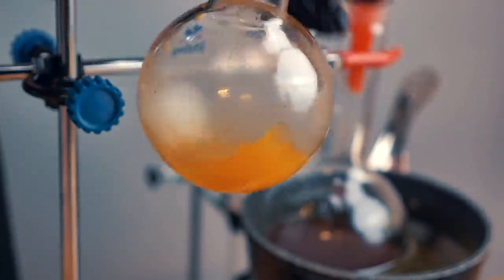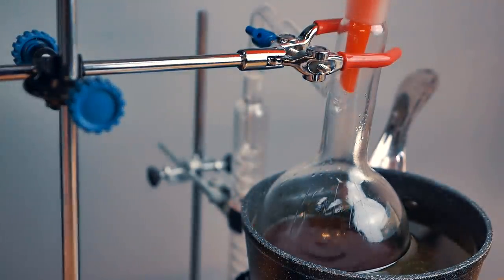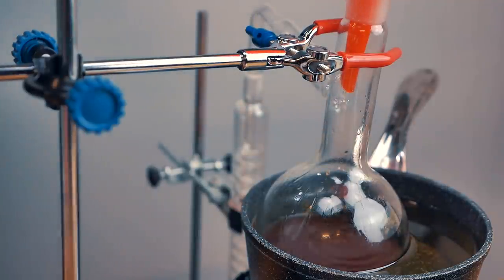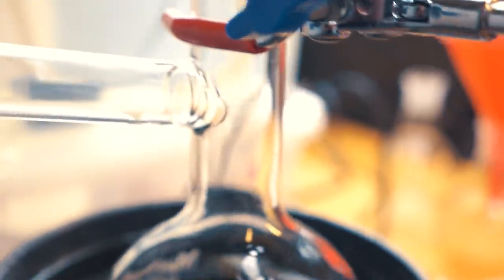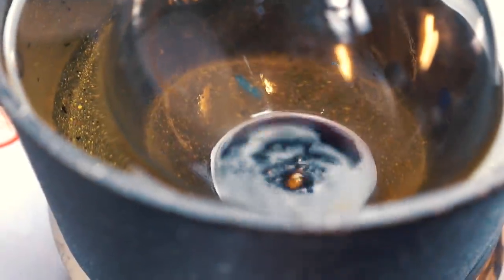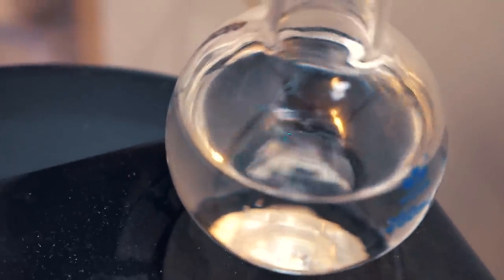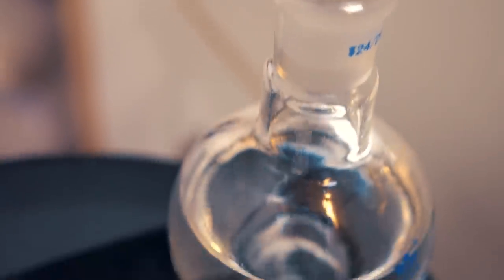Capsaicin that is left behind in the small beaker, just using a little bit more ethanol because we'll be able to recover that later anyway. And don't forget to add some of those anti-bumping granules to the flask, else you may come up against some problems. Because most of the ethanol now has boiled out of it and has distilled down into this flask. So that's got a couple more drops coming through, but I think I'm pretty much done. It gets quite difficult to work with this stuff if you boil out all the ethanol.